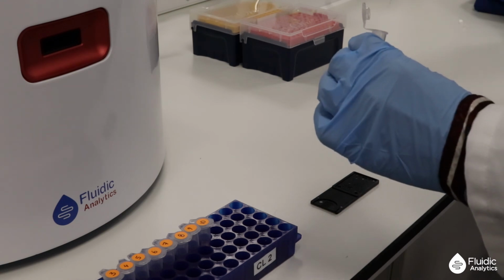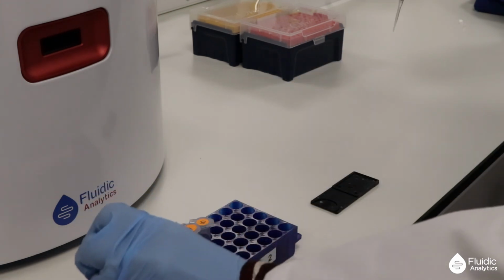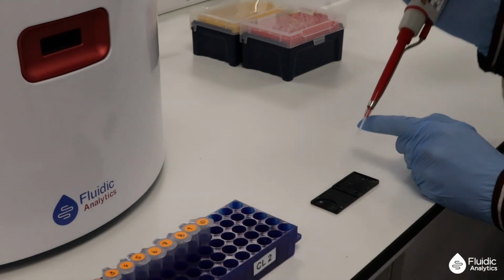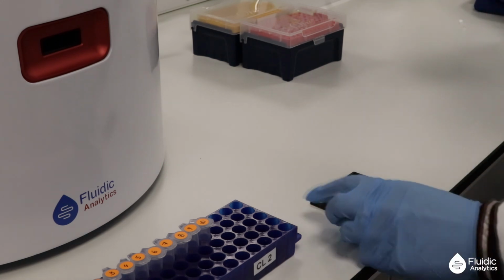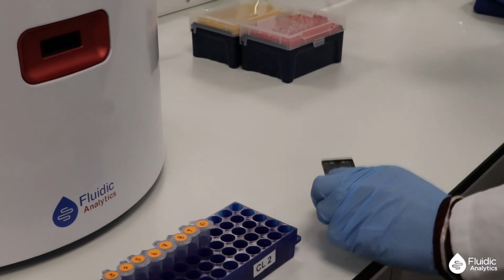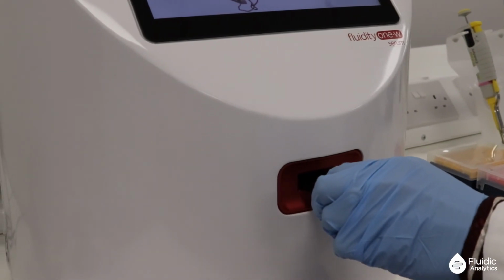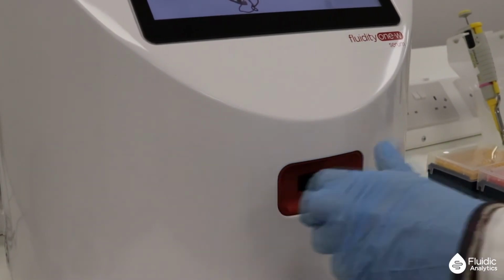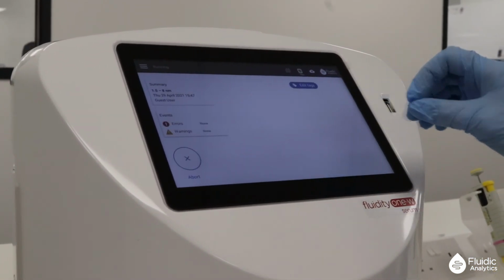We recommend measuring the hydrodynamic radius of your purified labeled protein on your Fluidity-1W or Fluidity-1W serum instrument to confirm that all free dye has been removed. If the size measured is smaller than expected, it is likely that the sample still contains free dye and a repeat purification step is recommended.